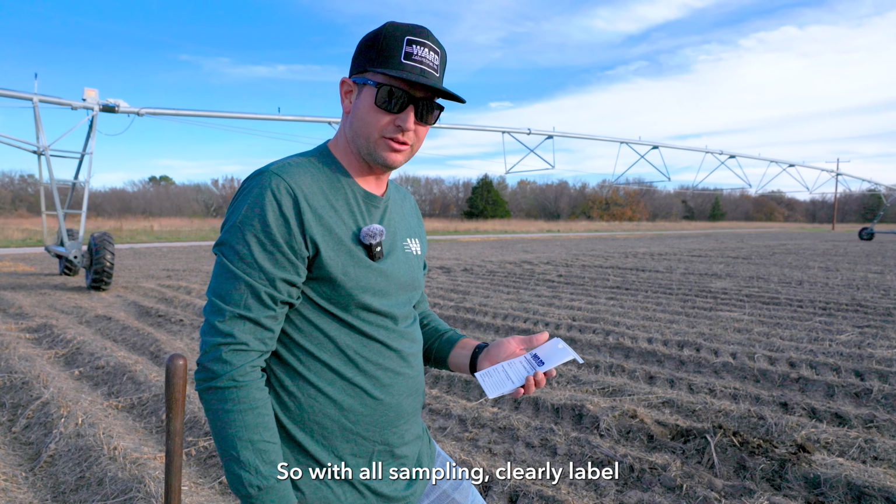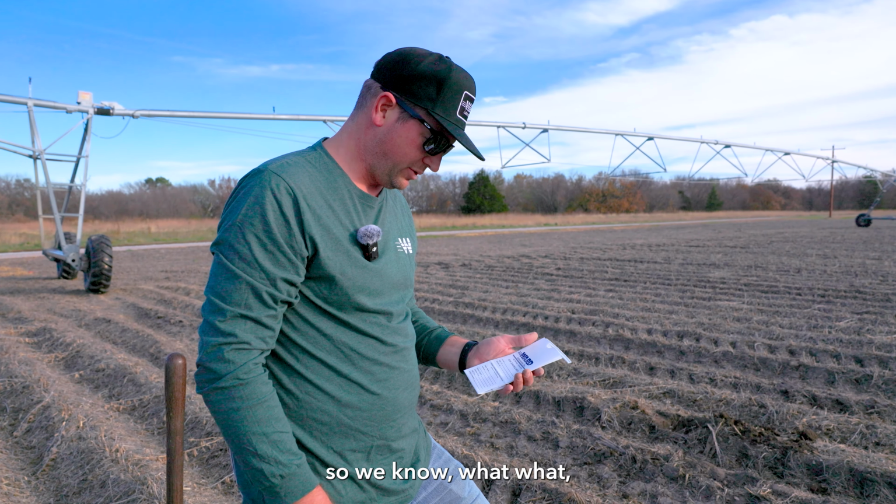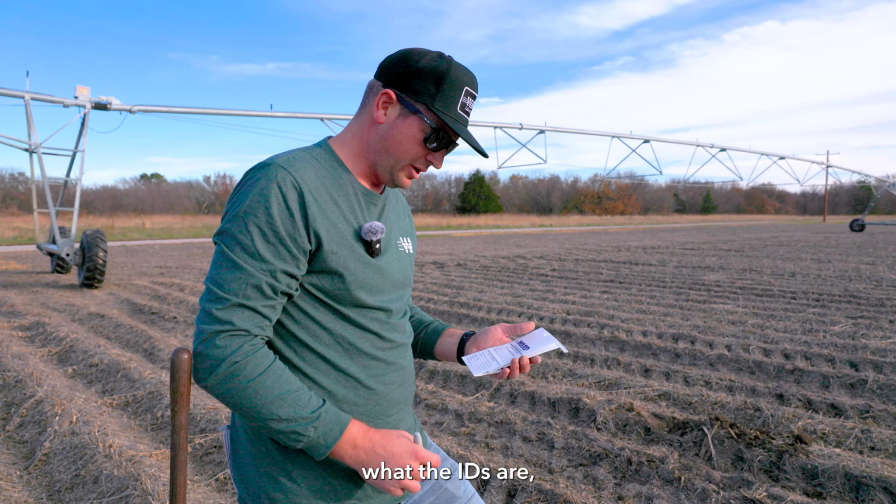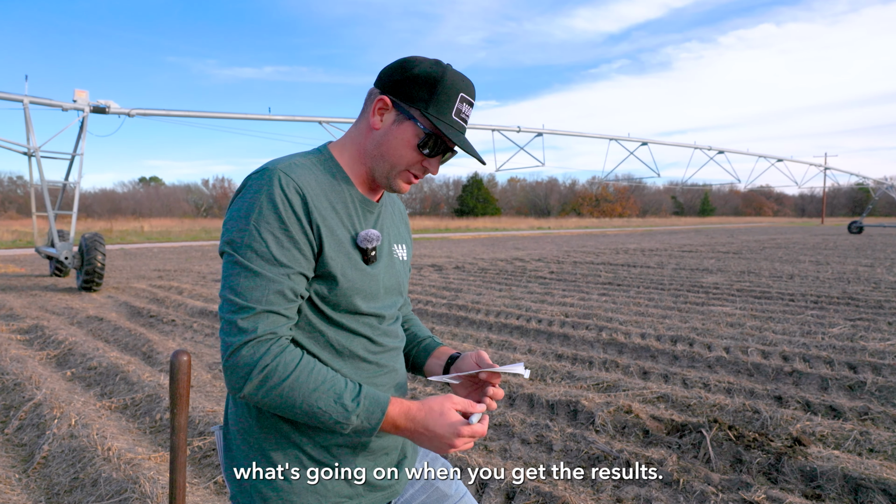So with all sampling, clearly label all the bags so we know what the sample is, who it belongs to, what the goal is, what the IDs are, so you'll know what's going on when you get the results.